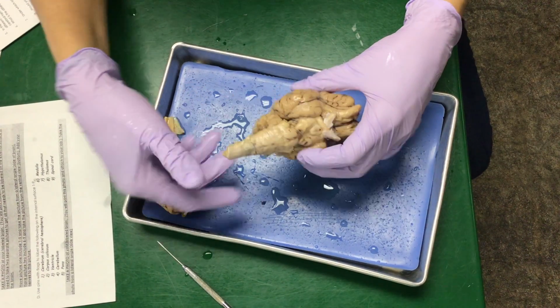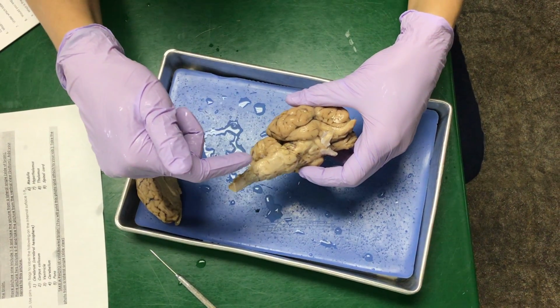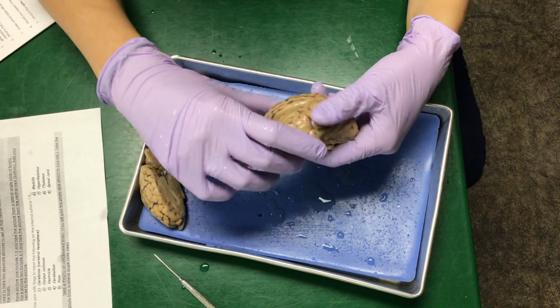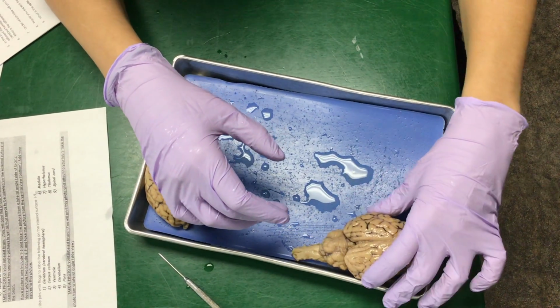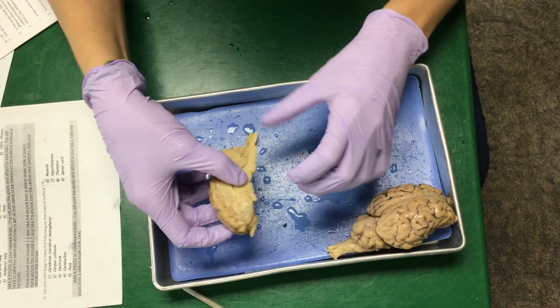Otherwise, you also need to point out the pons, the medulla, and the spinal cord, and that would be by bumps that you're seeing on the brainstem, that we talked about in class. Okay, so I'll give you a picture of this in multiple angles to label all that stuff that is found under number 4C, just C, on your lab.